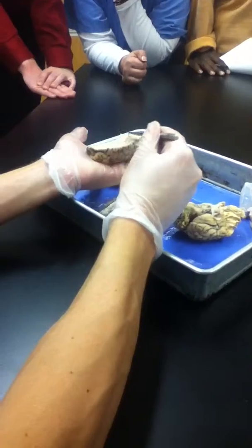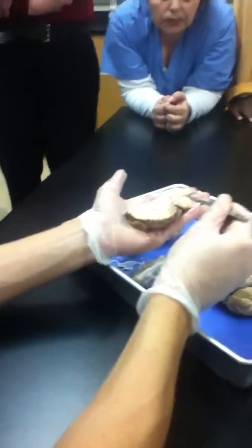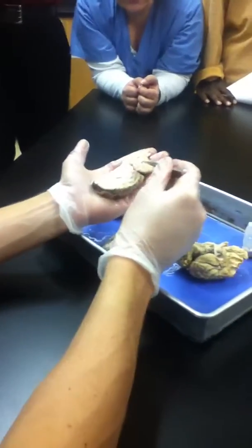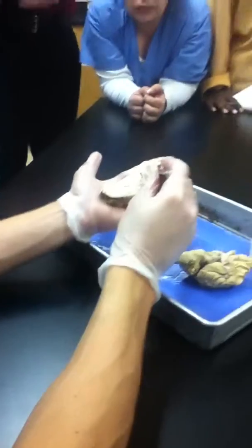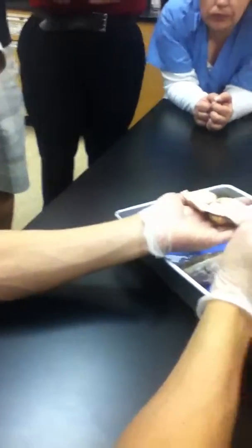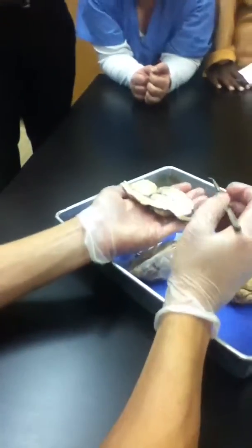Take, for example, now that we have sliced this brain region that you correctly earlier identified as the cerebellum, I could now put a pin, say, here, and you now would name what? Arbor vitae, exactly, yes, good. That hidden arbor vitae that you said, yes, we'll get to those, yeah, good.